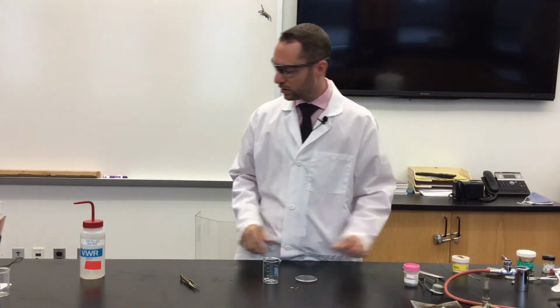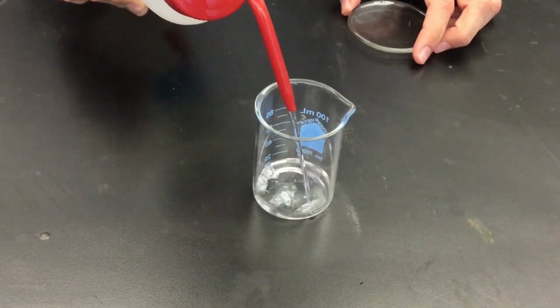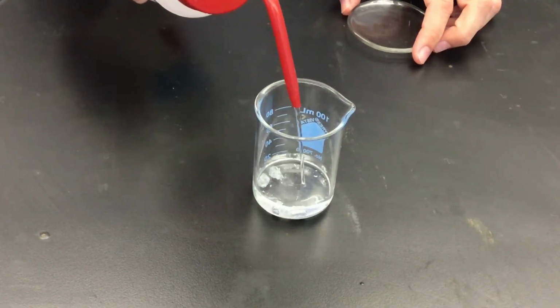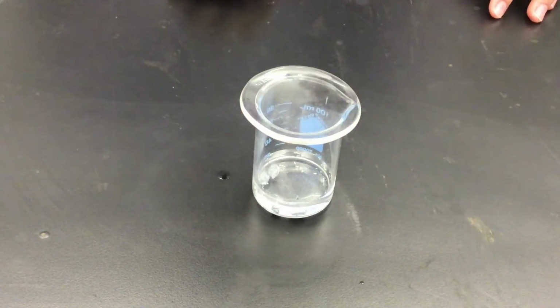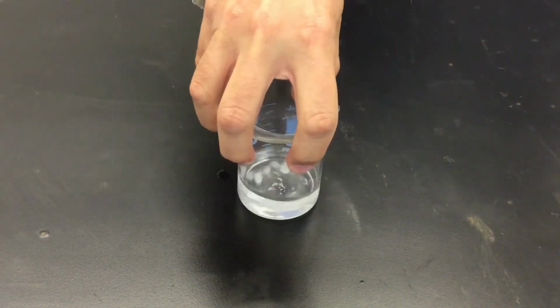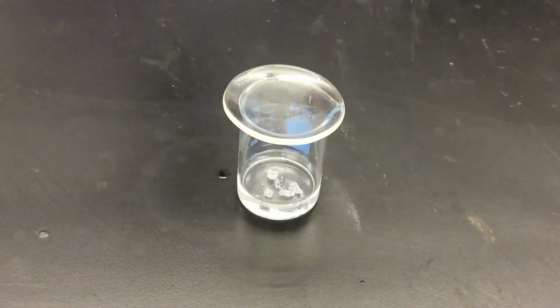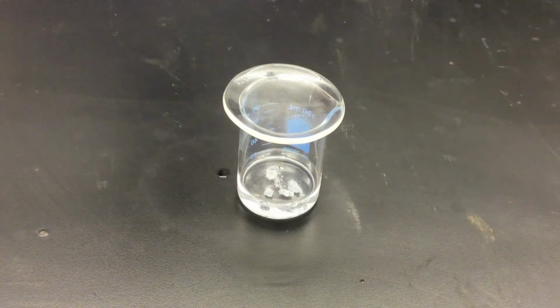always a good idea to put caps or lids back on containers so they don't spill or get contaminated. Now let's add the water. Again, we're looking for evidence or signs of a chemical reaction. Also think about the rate of reaction for the calcium in comparison to the magnesium. Which one is reacting faster? Which one displays evidence that's more noticeable?